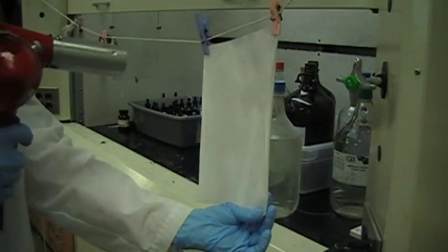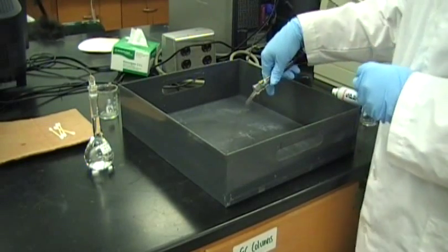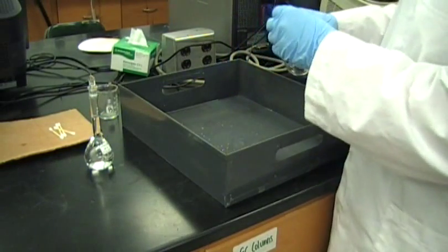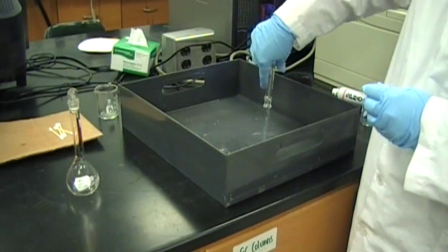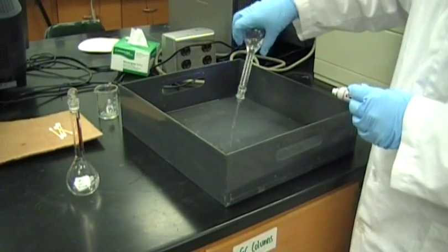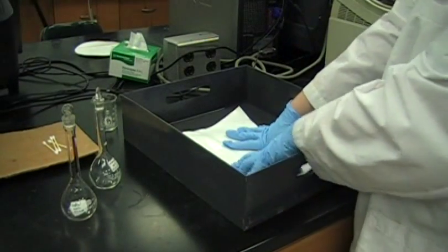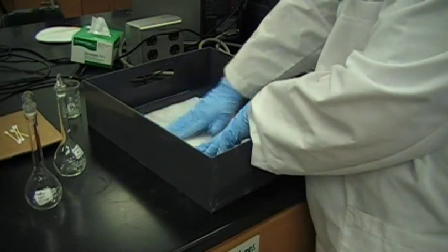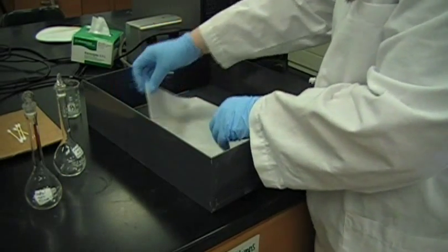The photographic paper is then dried using a heat gun. Next, equal parts of 1-naphthol and sulfanilic acid are mixed in a shallow pan. The photographic paper is saturated with the mixture. After the paper is completely saturated, it is air dried and stored in a dry place until used.